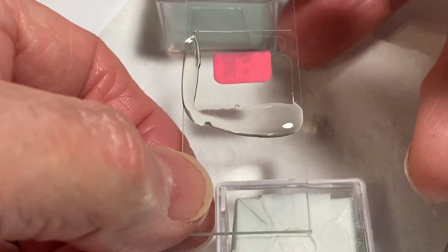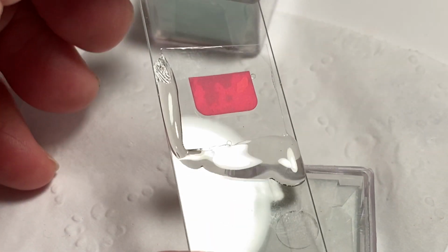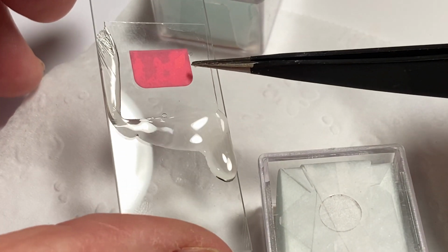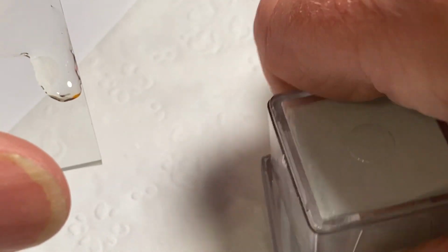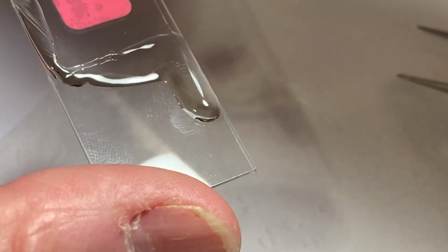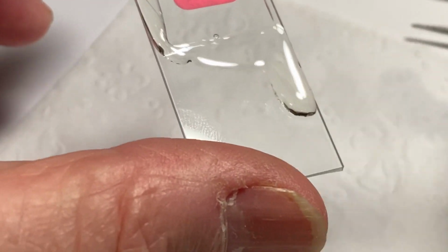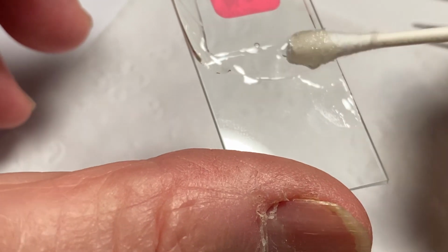So once you have the xylene and the cover slip on there, and look, if you can see, would you believe there's an air bubble? Right there. Or is it an air bubble? Yeah, it's an air bubble. I'll be darned. So there's no escaping those air bubbles. And you can see the xylene is running down the side there. So once you know that the entire cover slip has moved all the xylene out, we can pick up this extra along here like this.